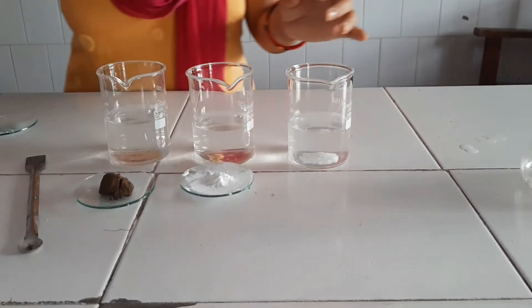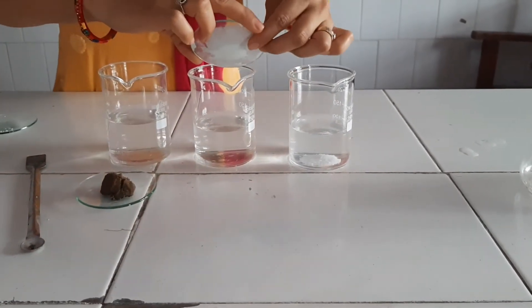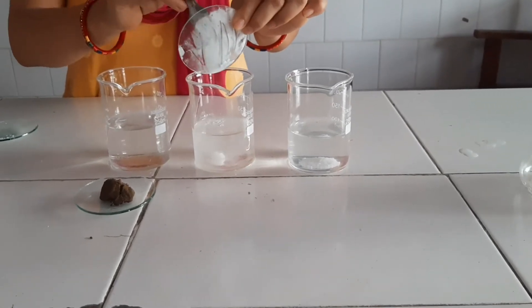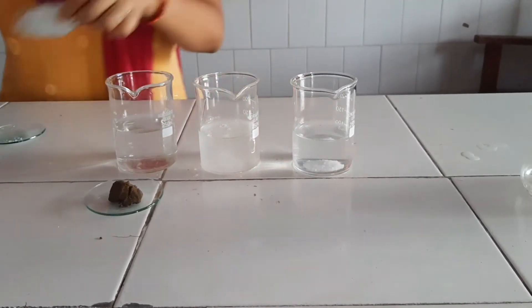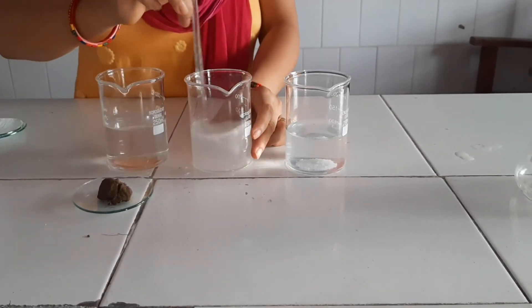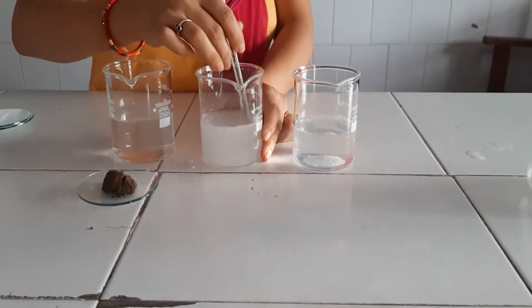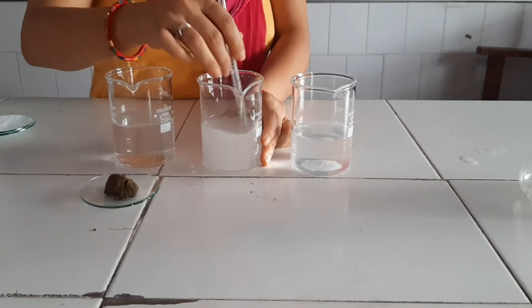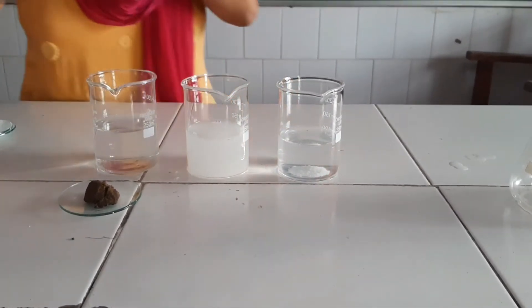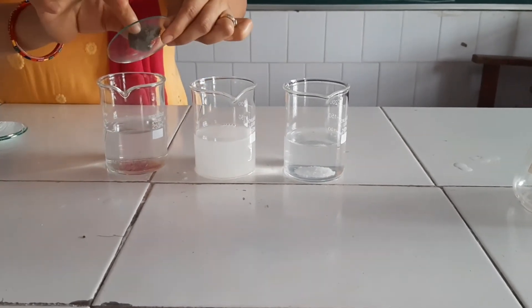On the second side, we have another sample of starch which we are going to add to the water, and with this we are going to prepare the colloidal solution. Colloidal solutions look homogeneous but actually they are heterogeneous. We have taken a large amount of starch, so some is soluble and some settles at the bottom. The third sample is sand which we are going to add to the water to prepare the suspension.